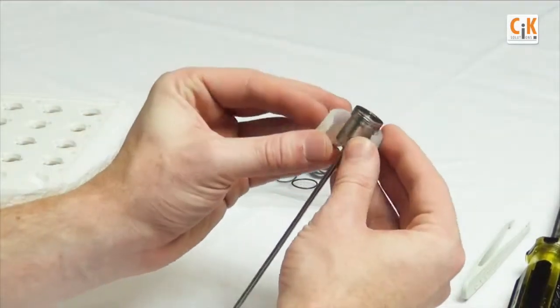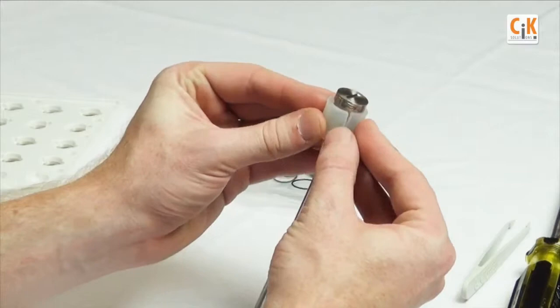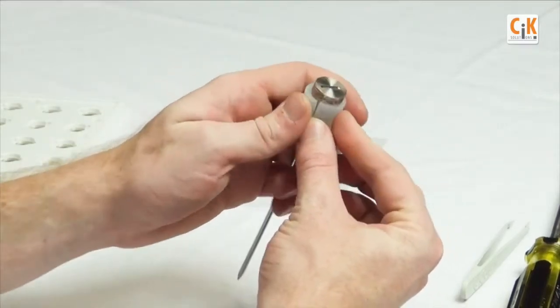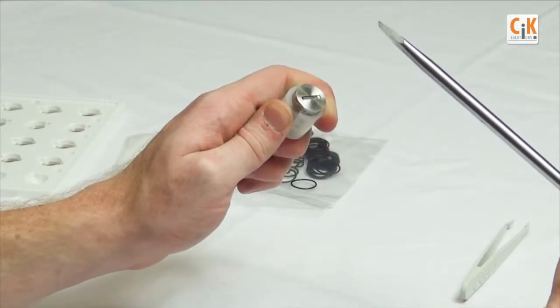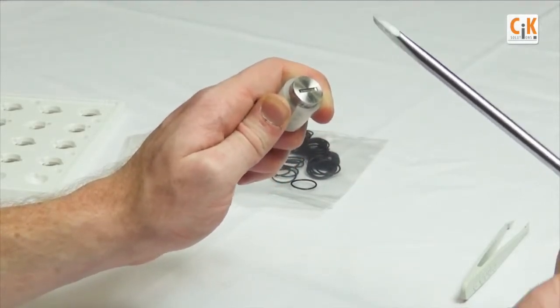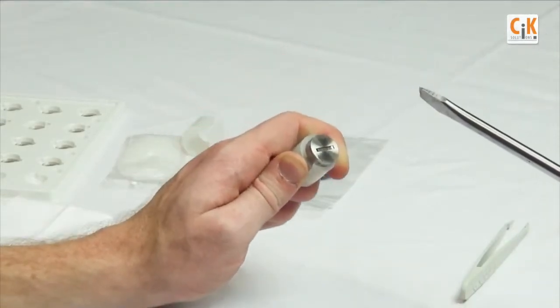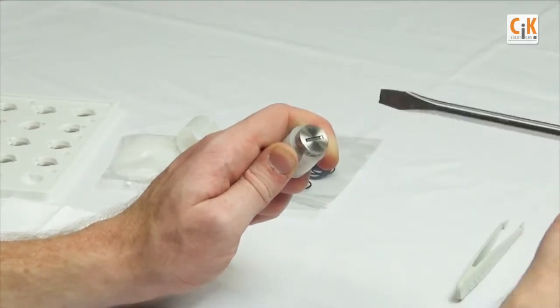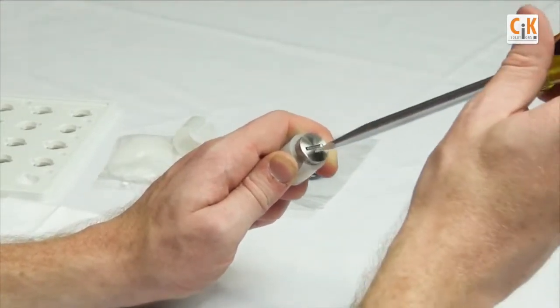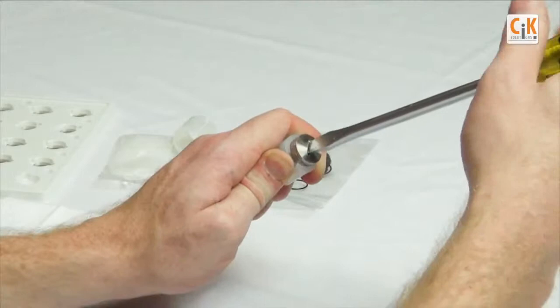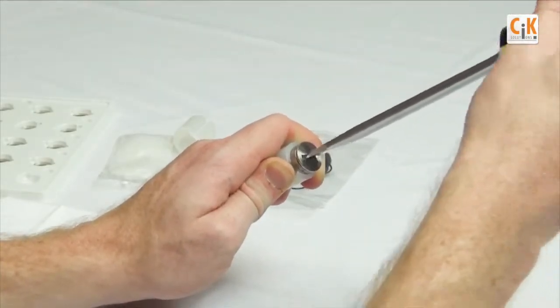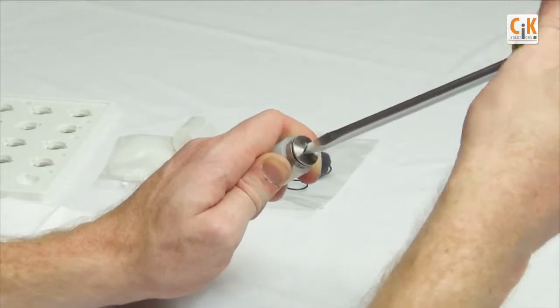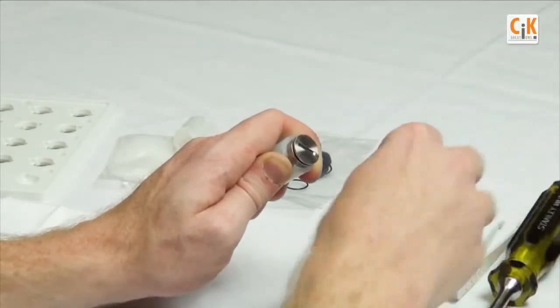Place the logger gripper over the body like so and twist the battery cap counterclockwise with the other hand. Use a coin or like a nickel or a flathead screwdriver just to get the cap loose.